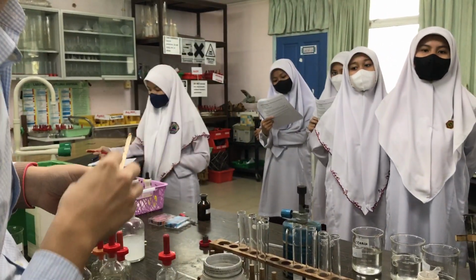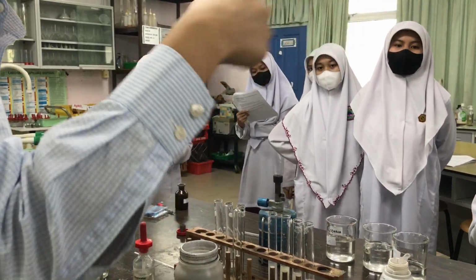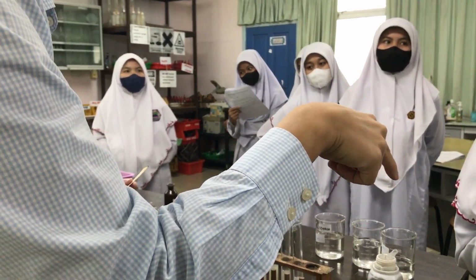What did you see? Did you see it? Did you see it? Did anyone not see it? Did you see it? What was the test for? Test for what gas?